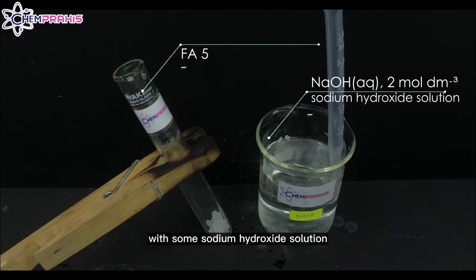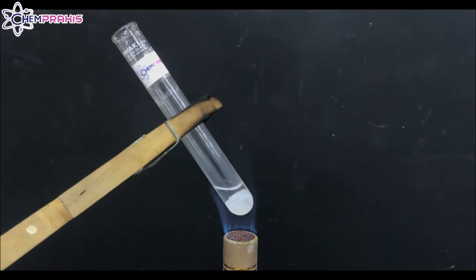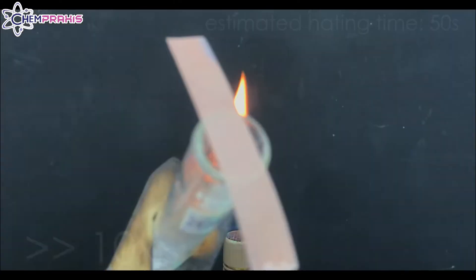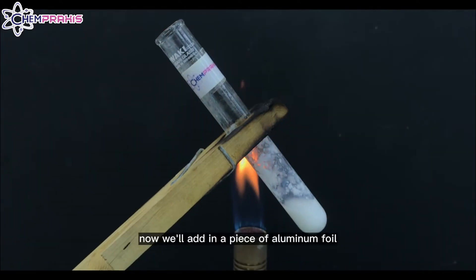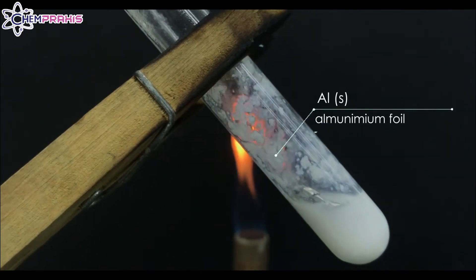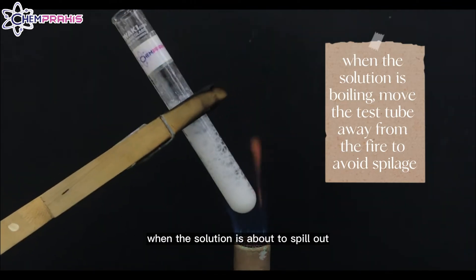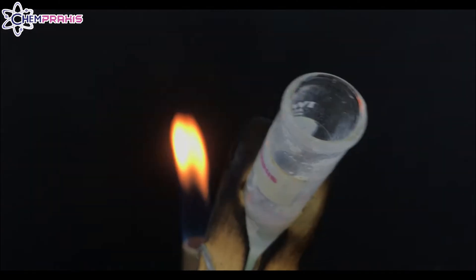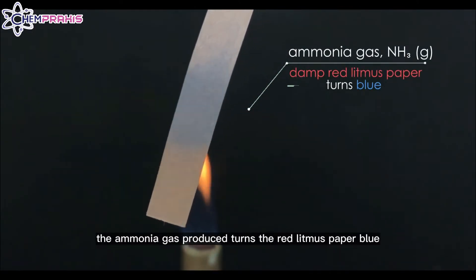First, we'll warm the FA5 with sodium hydroxide solution. After heating, we'll add in a piece of aluminum foil. Use a glass rod to put the aluminum foil into the solution. Make sure to move the test tube away from the flame when the solution is about to spill out.